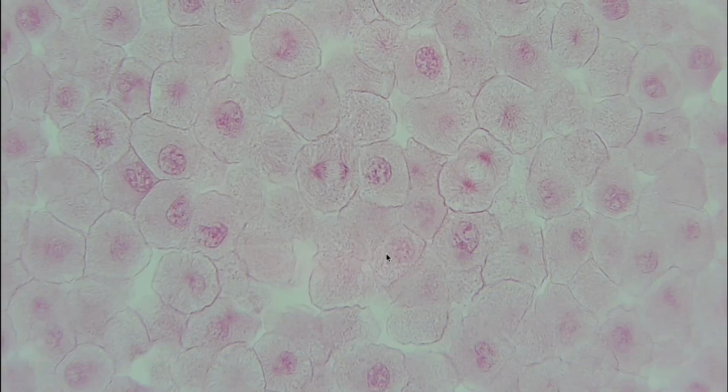All right, and so here is where we have that same problem. Maybe we can see that this is going to be anaphase and this is going to be telophase, but you might be wondering why. We can't really see a cell plate or cell wall, but what we can see is what we have in animal cells, which is called a cleavage furrow, which is this little indentation right here to show that we're starting to separate into two different cells, right?